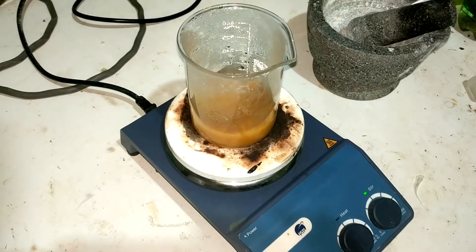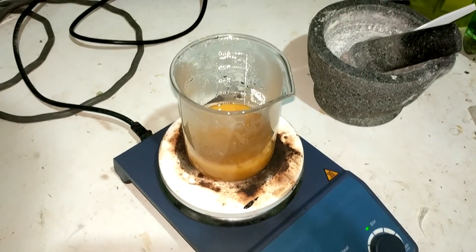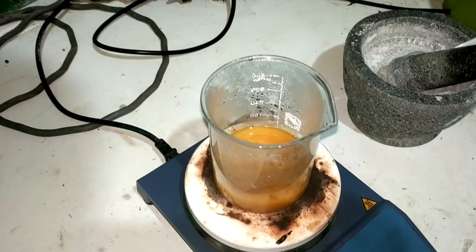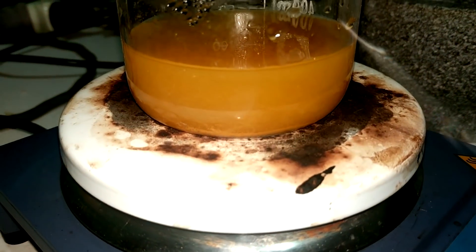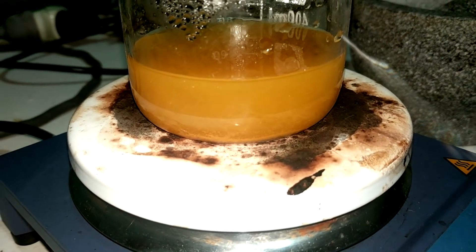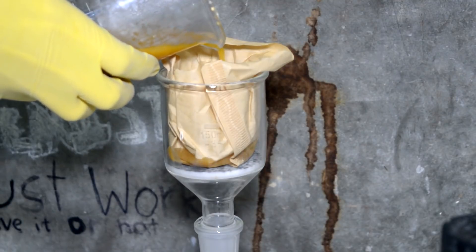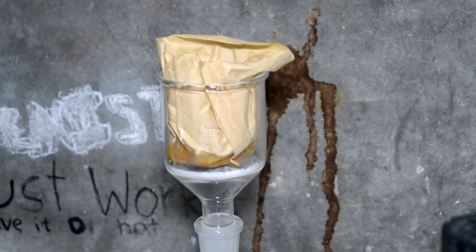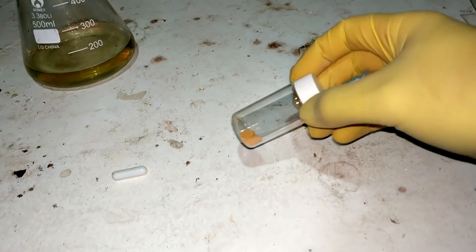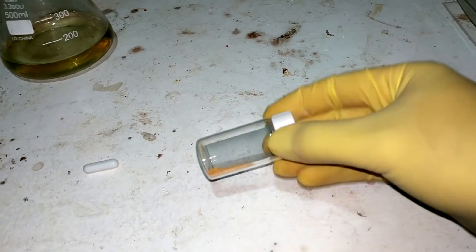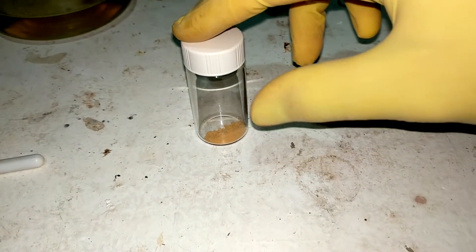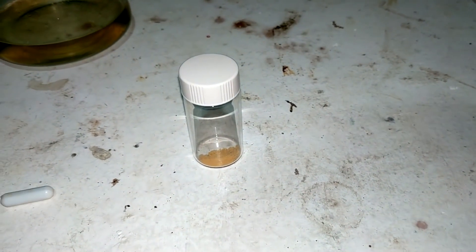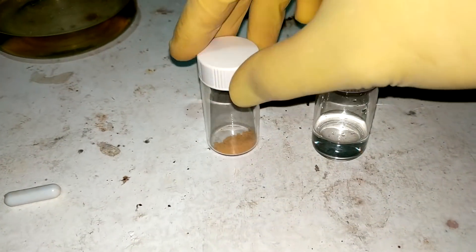All right it's looking very good actually. I was a bit worried but they're looking very good so I just heated it up to try and get it all dissolved and all the cake has broken up. You can see settling there so it's not colloidal. Then filter, wash with a little ice-cold water and dry thoroughly on the pump. And here's our final product. It's 334 milligrams of fine dry powder that's completely non-hygroscopic.